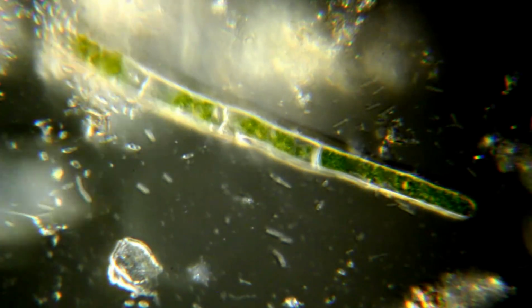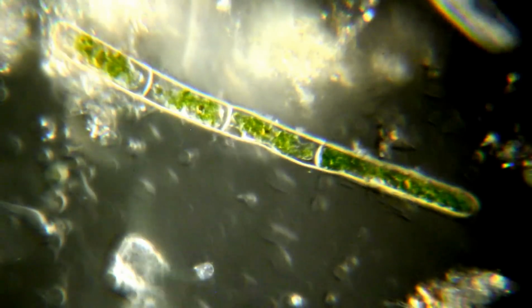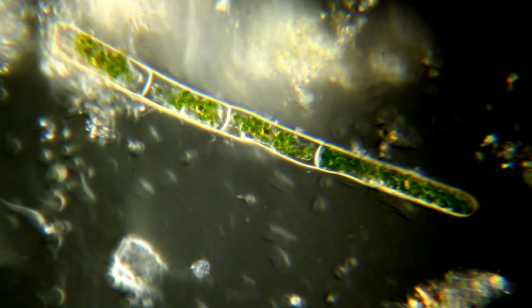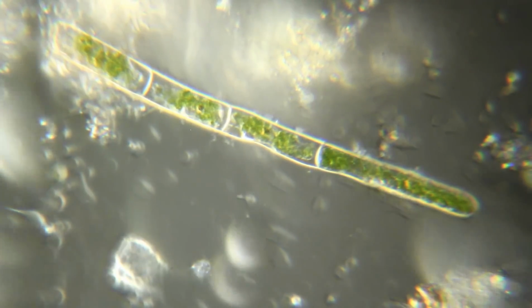But that's it, and see if I can get one of these little critters into focus better. They're moving so fast that, and I'm using the Zeiss turret with the Zeiss phase 2 lens.